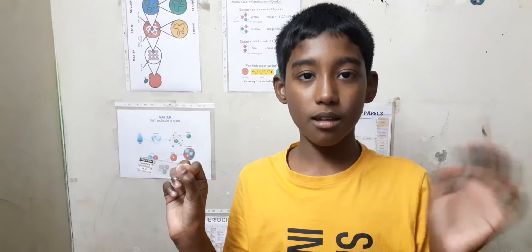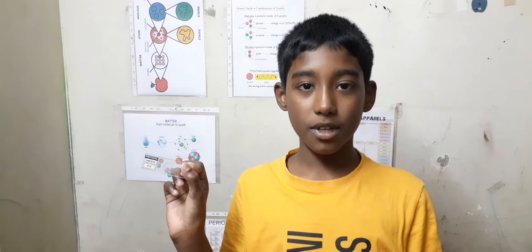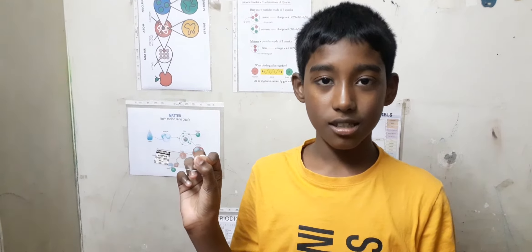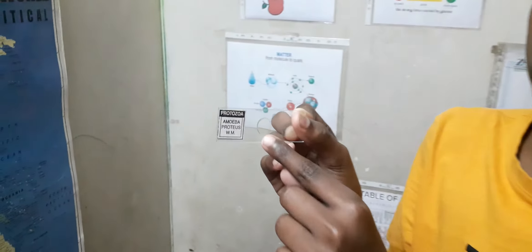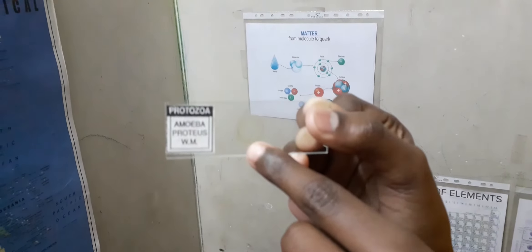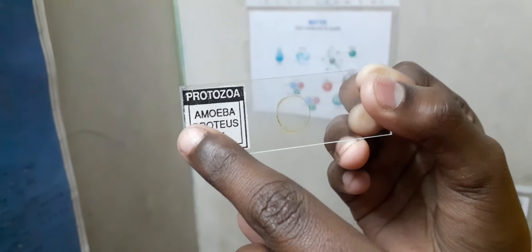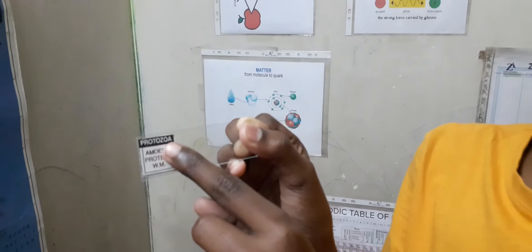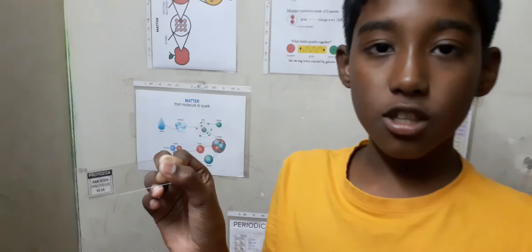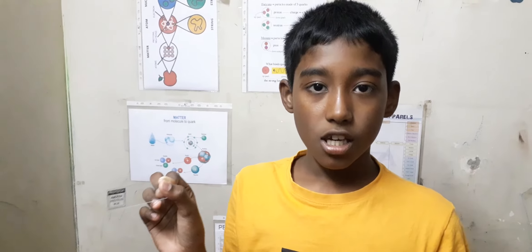Assalamualaikum and hi everyone. Today I'm going to tell you about microscopes and slides. This is an amoeba slide — scientific name Amoeba proteus. This is a protozoa, which means one-cell eukaryotes.